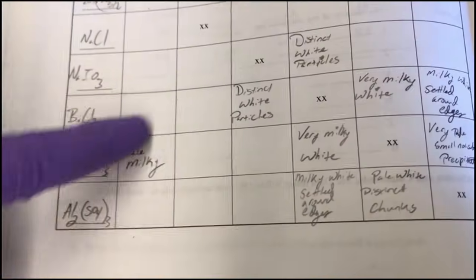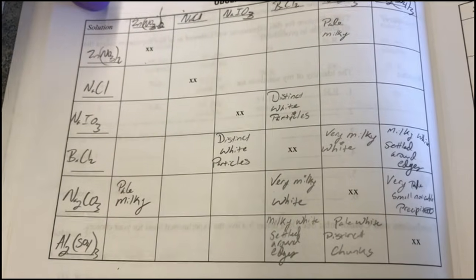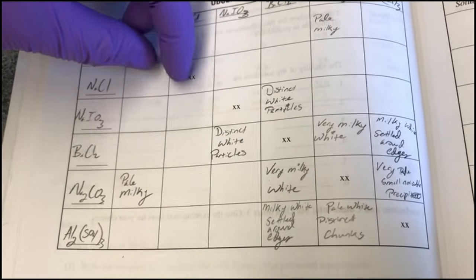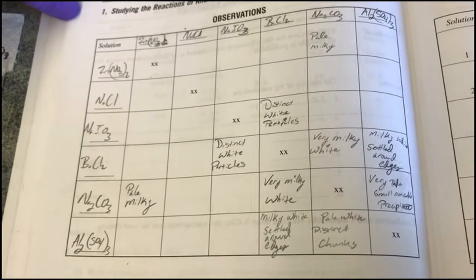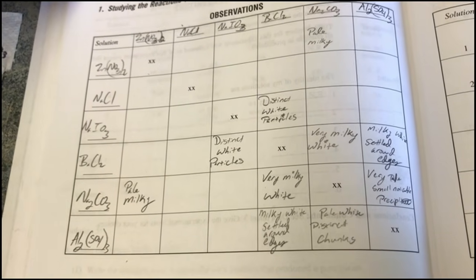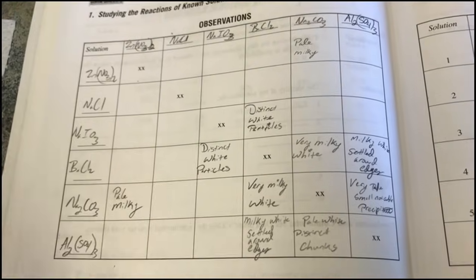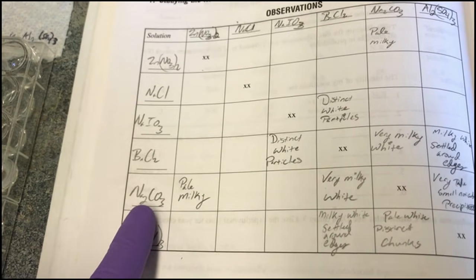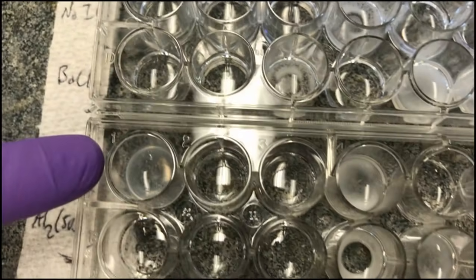And the same thing actually happened. We have this line here, like we had mentioned before, where it's the same compound going in, so there's no chance for there to be a precipitate if you combine two of the same things. No reaction will occur, or if it does occur, then you know that the solutions are impure. It's mirrored on this side where we have, again, our zinc nitrate and our sodium carbonate. So again, it's right here. That one's way easier to see on the camera.